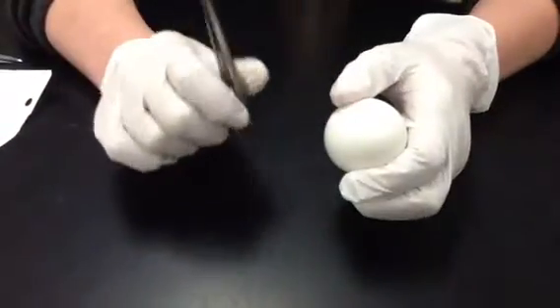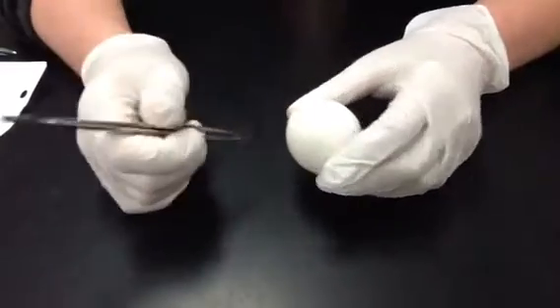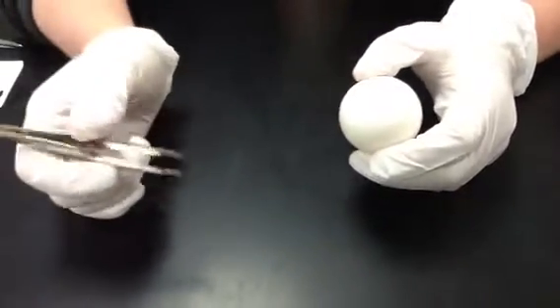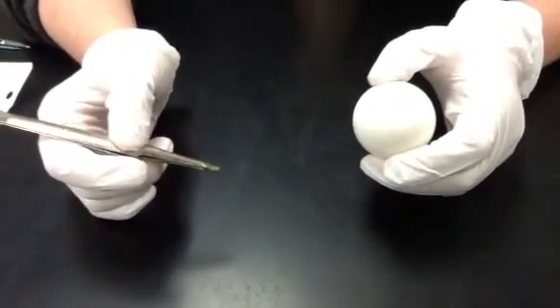Okay, so today you're going to do an egg dissection. You're going to watch the video of me doing it, and while I'm dissecting the egg, you are going to be completing your Eggsploring the Egg Lab with your partner. Remember, this is a video, so you can pause, rewind, fast forward at any point that you need to.